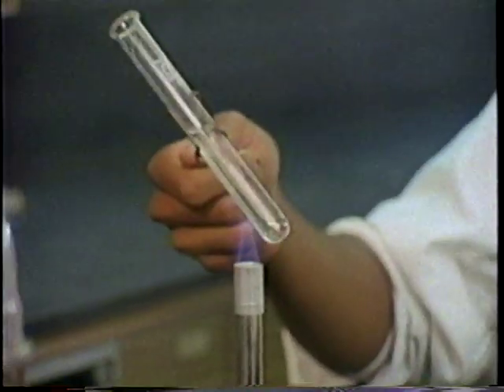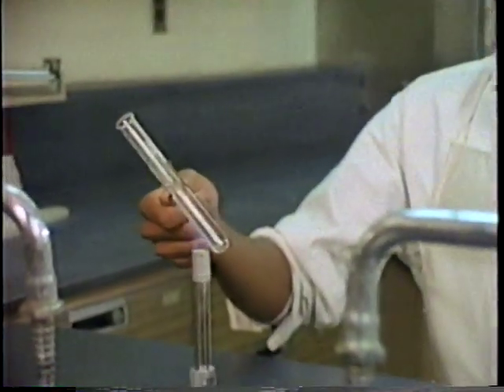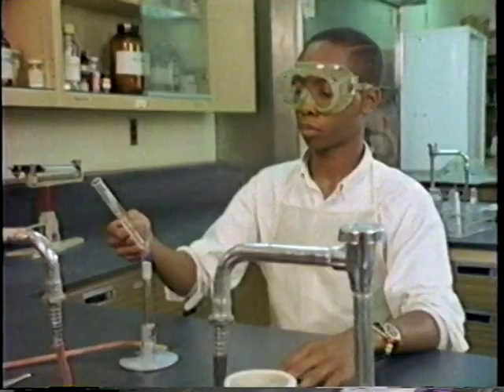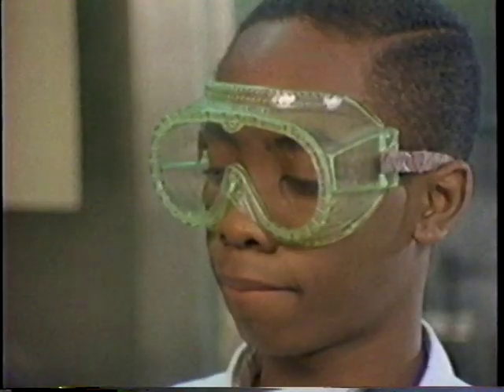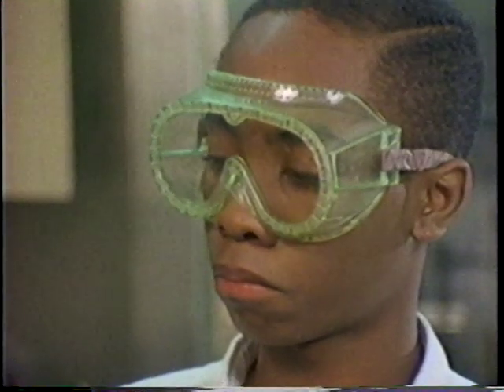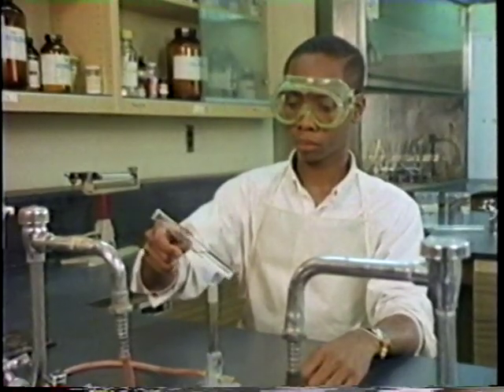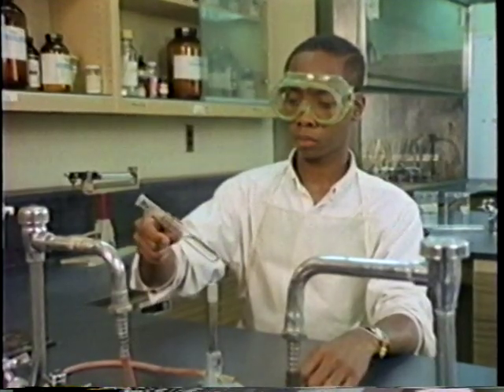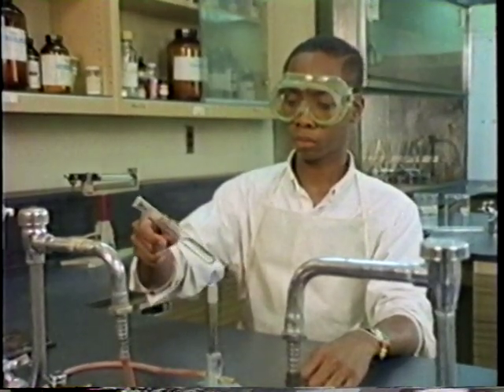Then what? I had to heat some chemicals in a test tube. As always, I made sure the open end of the tube was pointed away from me. Why is that? For safety. When chemicals are heated, they can boil over very quickly and shoot out, especially when they're in a test tube. So what you gotta do is keep the open end of the tube pointed away from you and anyone else. And you should move the flame along the length of the test tube, not just at the bottom.